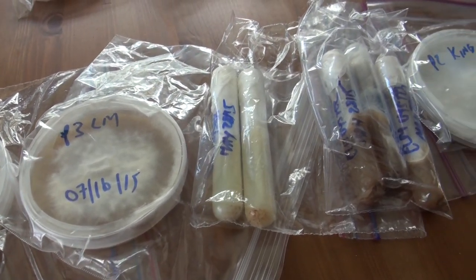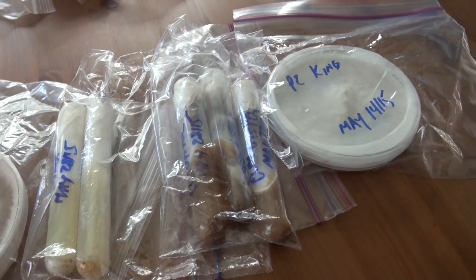The purpose for doing this is so that you can transfer mushroom cultures from one dish to another in order to grow out the culture and eventually add it to grain spawn which will eventually add to a substrate to grow mushrooms.